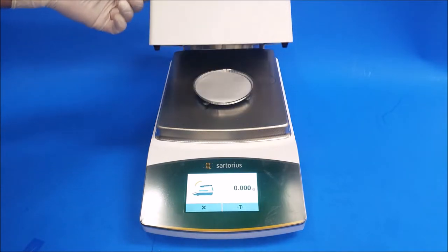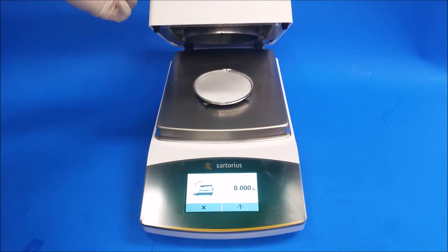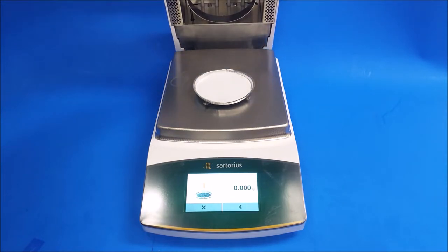Now open the hood. Don't just open it halfway. You need to open it all the way until I ask you to add the sample.